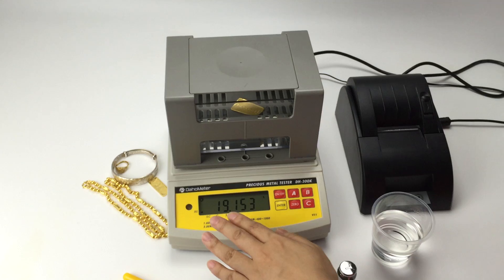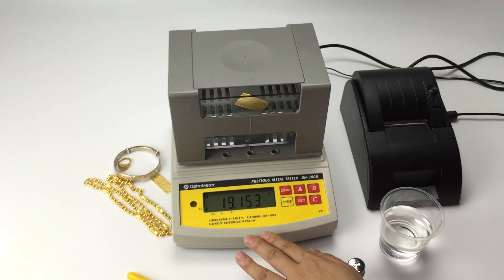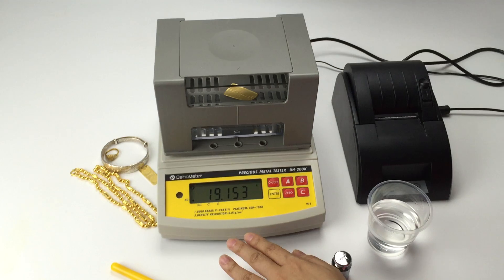Which means 19.153. It is the density for this sample.